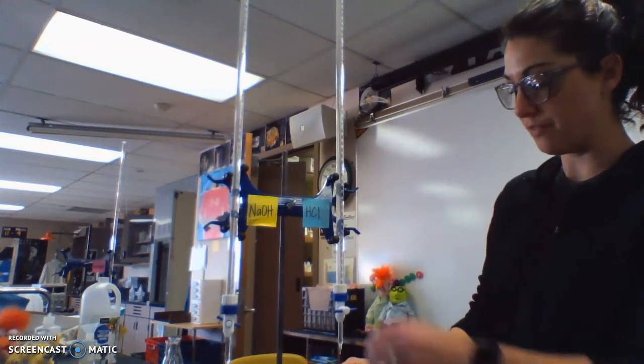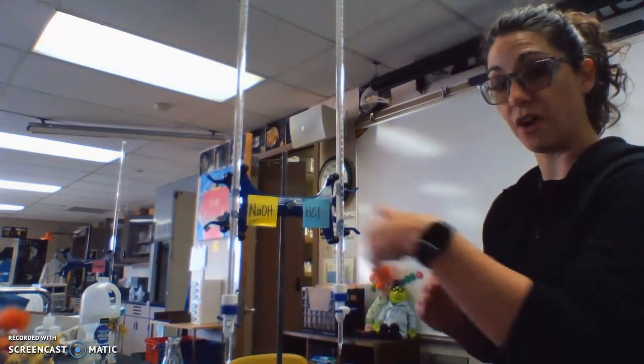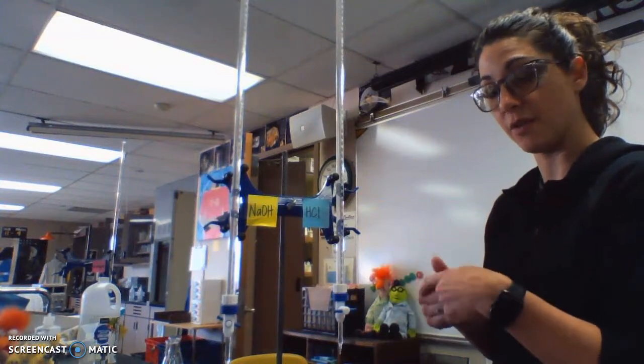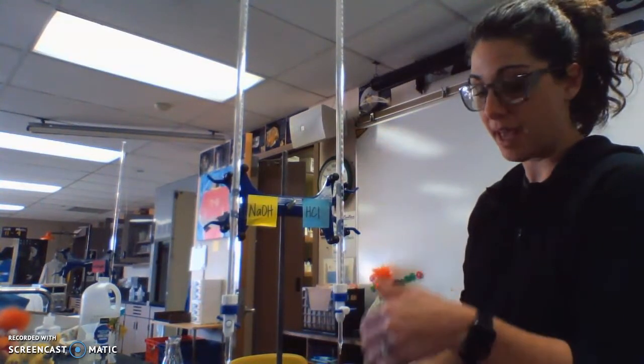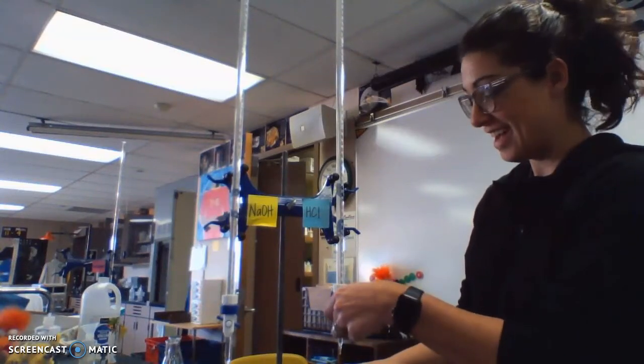I'm going to add about 25. I'm not going to record this final volume because if I go too far past the equivalence point, I can add more HCl to counteract it and go back. So what I end with right now is not necessarily going to be my ending value when we're done. It kind of depends on how well I do.